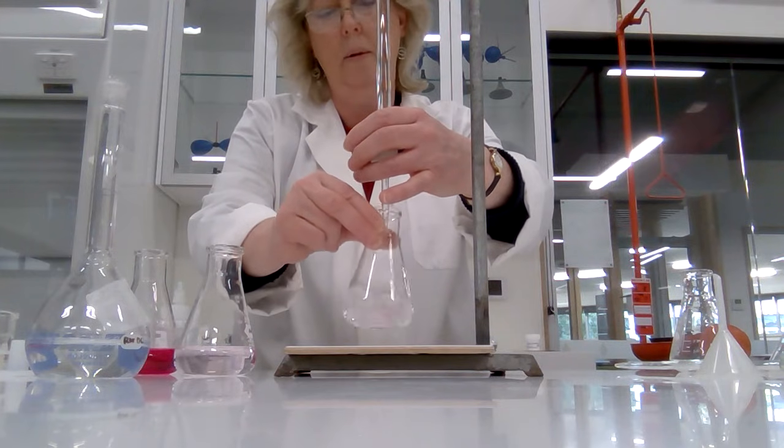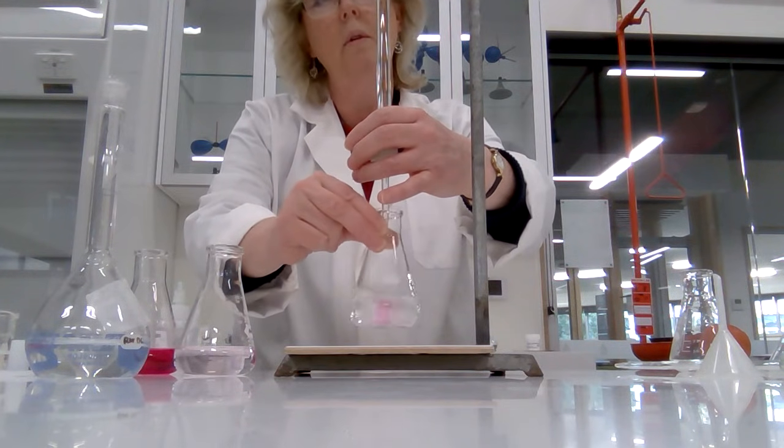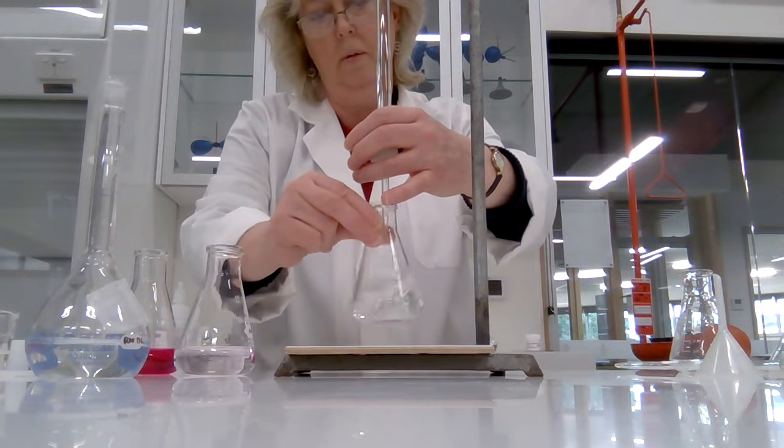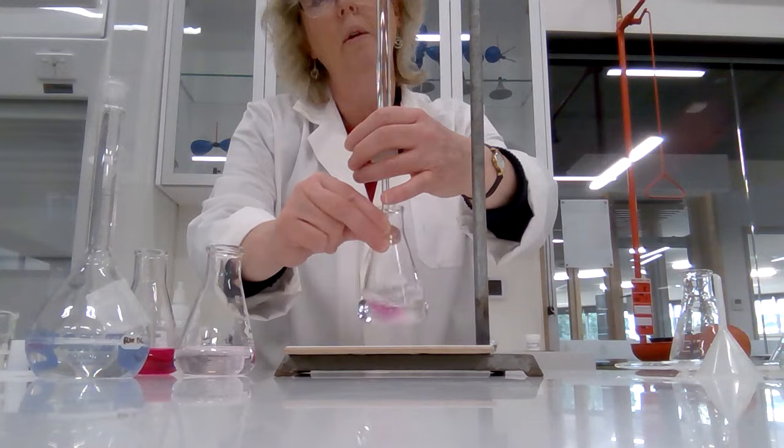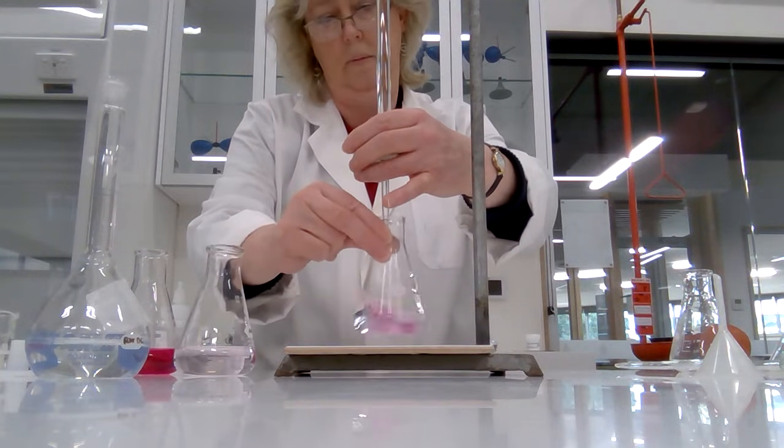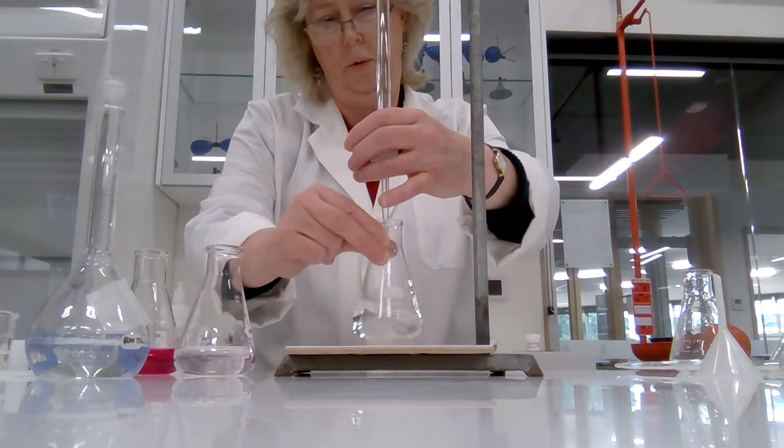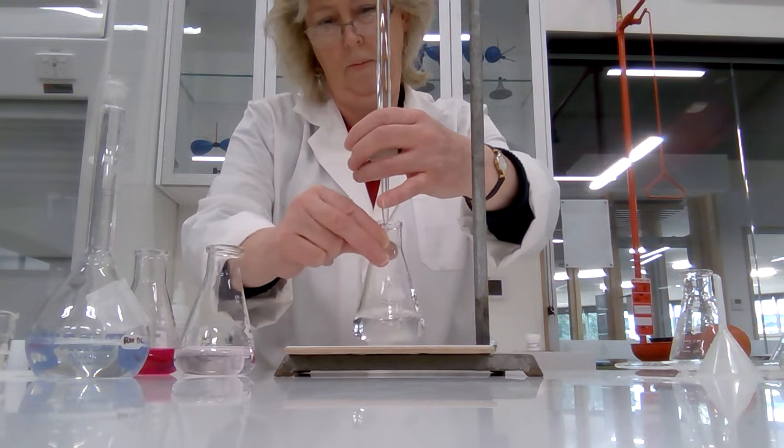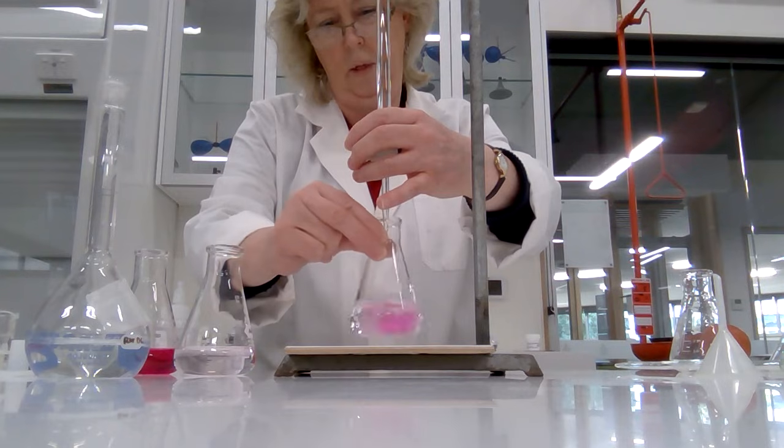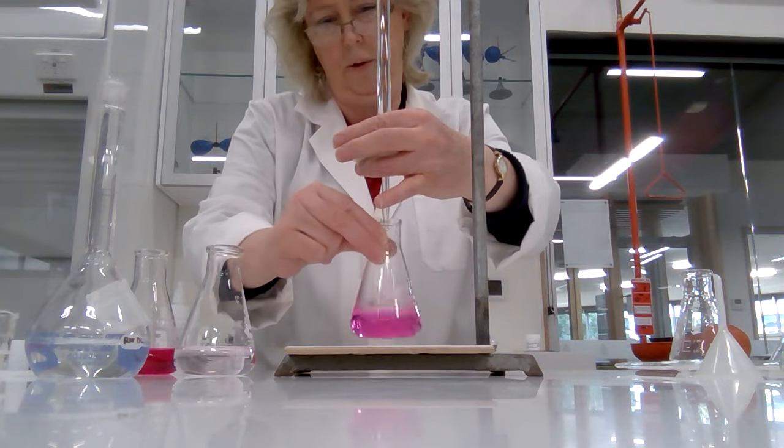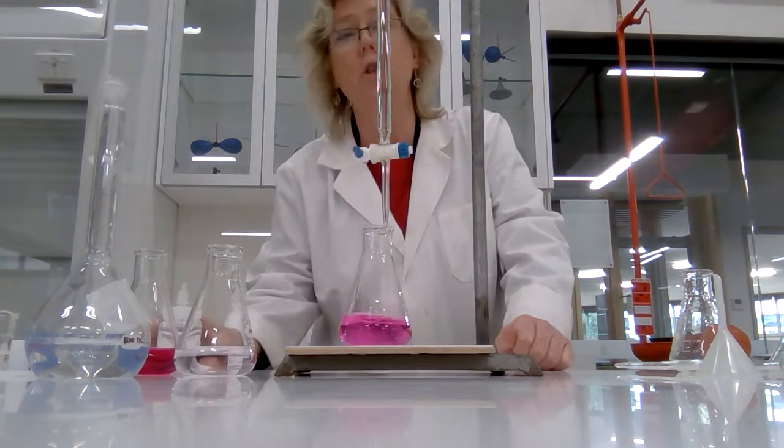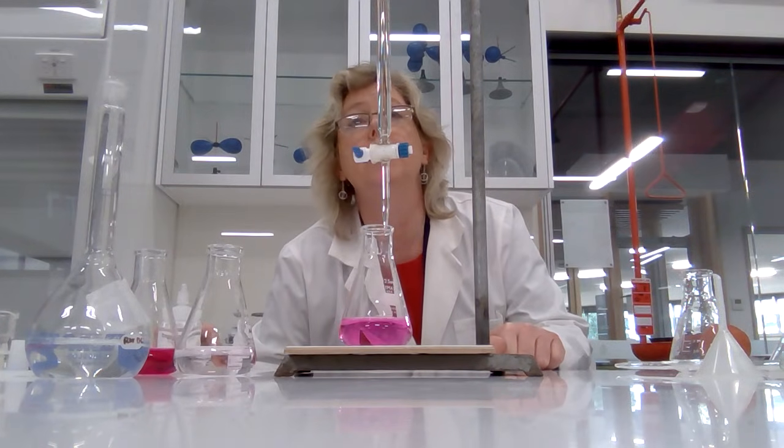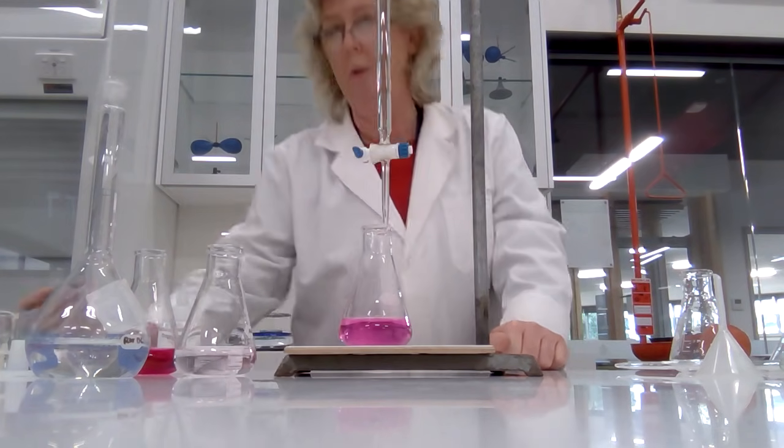40. Drops. And there we have it. Oh, might be a smidge over. That's okay though, 41.40. That's fine.